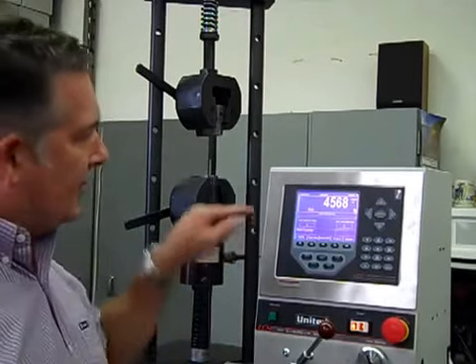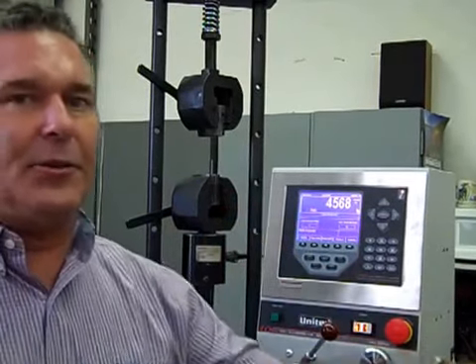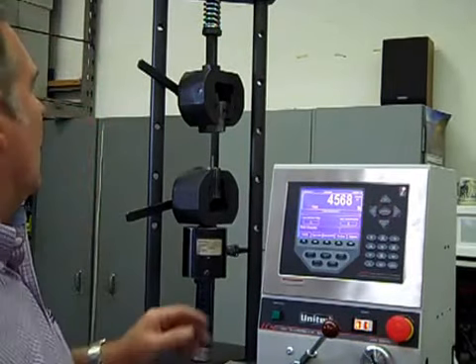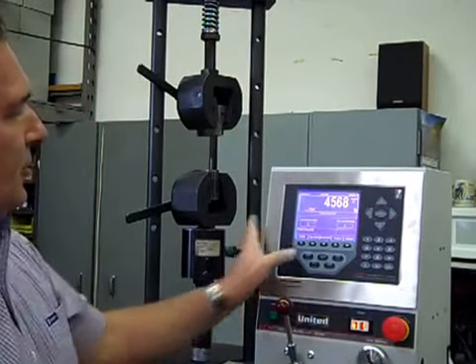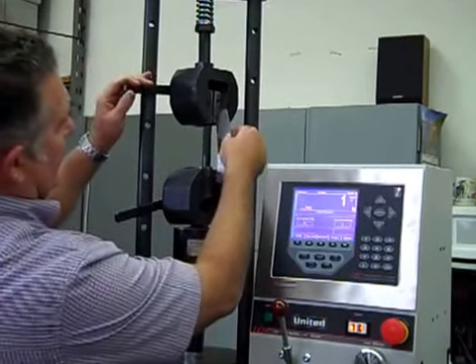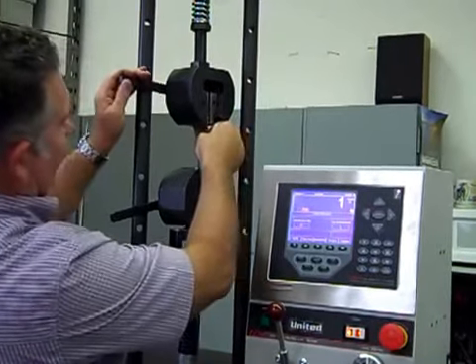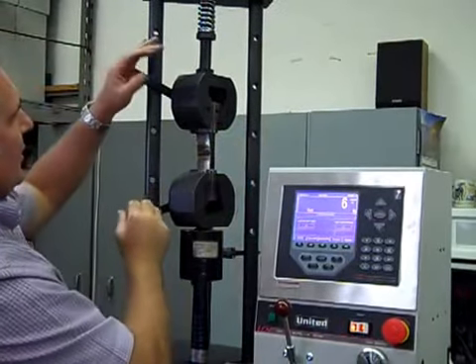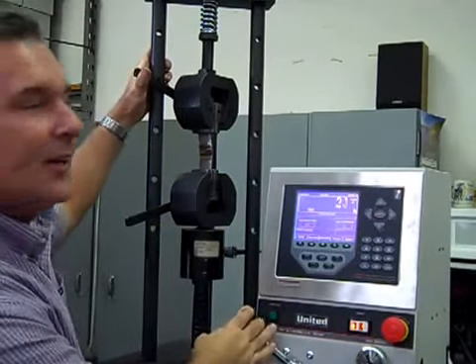So the operator could send the data to a computer, an access database, an Excel file. Put the machine in neutral, zero it, next coupon. Insert it into the machine. Snugging the grips, put it in gear.